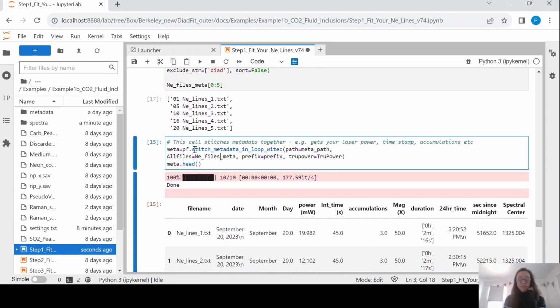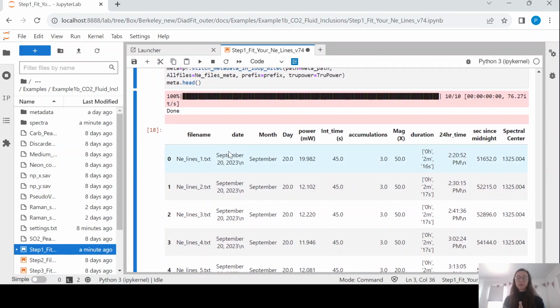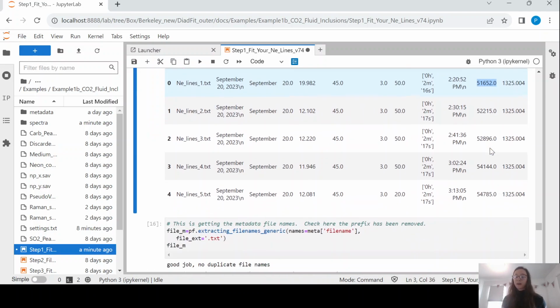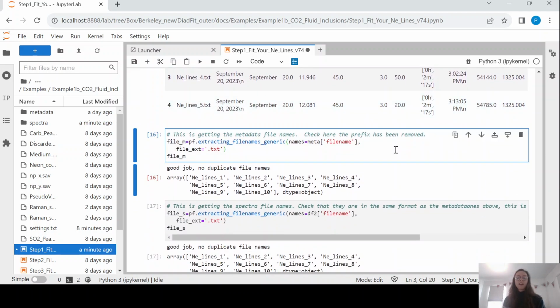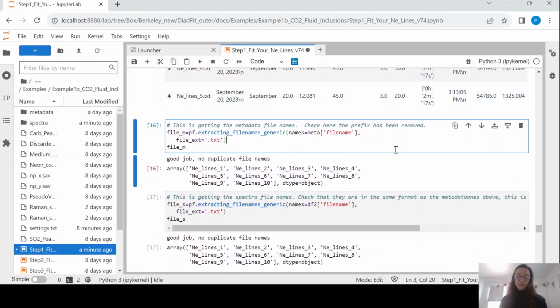There's then this function for WITEC, stitch metadata in a loop, and this basically extracts all of the useful metadata. So you can see you've got the file name, the date, the laser power, the integration time, the accumulations, the magnification you used. And most importantly, we've added this column here. This is the seconds since midnight. It's basically how far through your day after midnight you acquired this neon line. And this is the x parameter we're going to use to build that regression model. So what you might have to do is just get those file names.